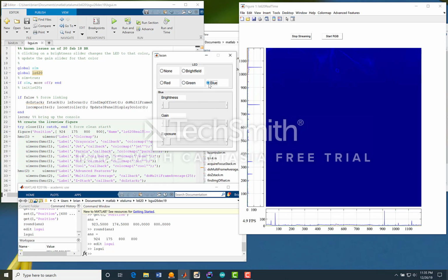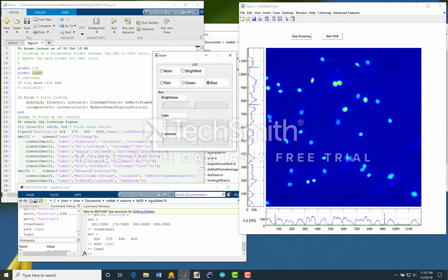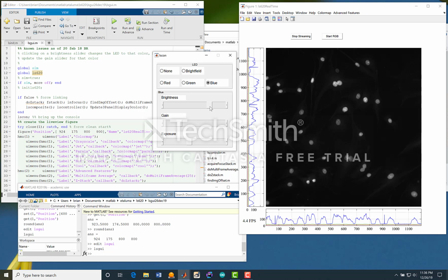And if we move on to blue, it'd be nice to have some brightness and some more exposure. See that we're starting to get some background. Let's really use some gain here so we keep our frame rate higher, and take that up just a little bit more. One of the things I don't like is this color map, so let's go to grayscale. And so there's our DAPI for blue.